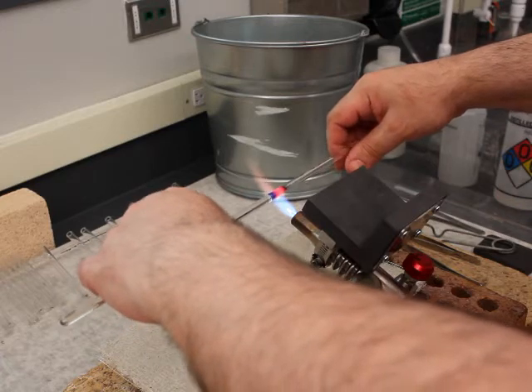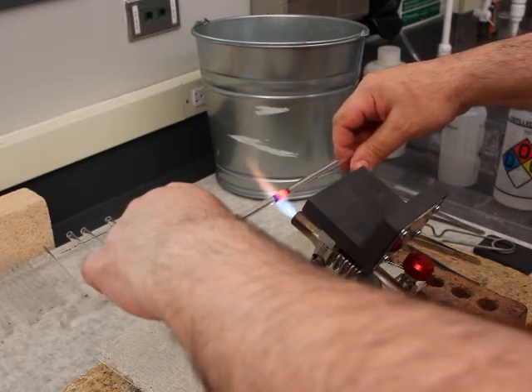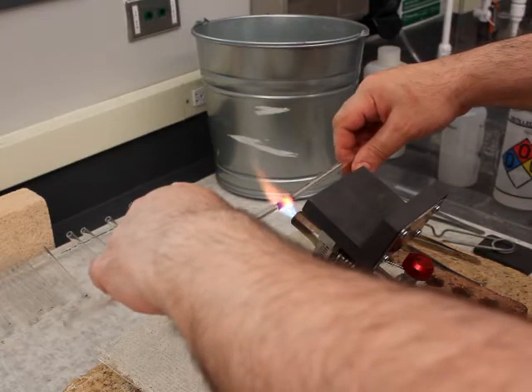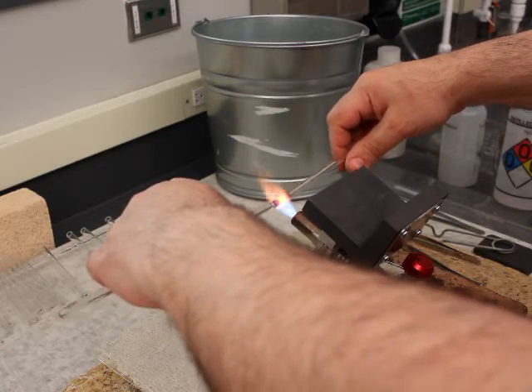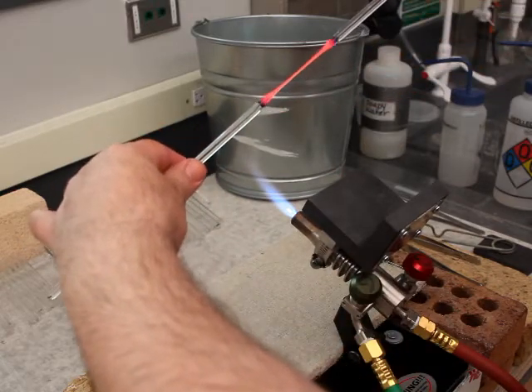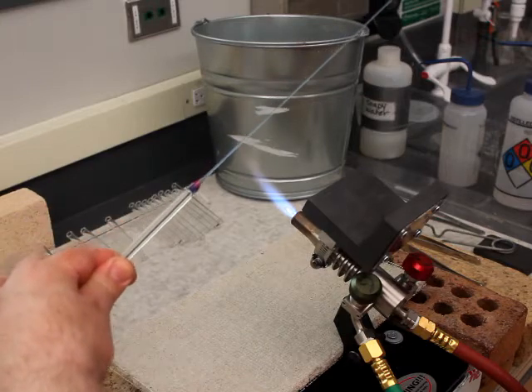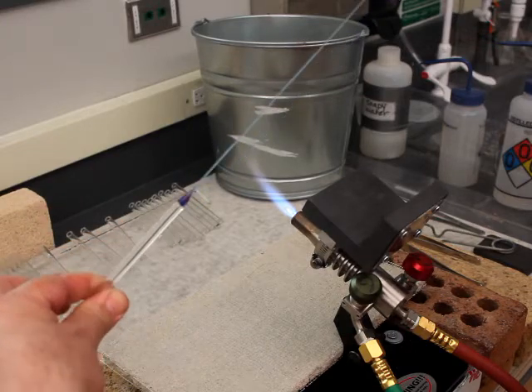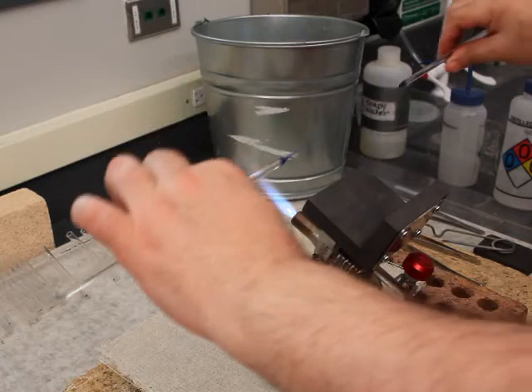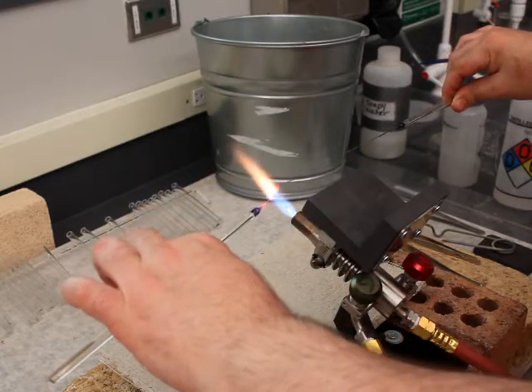Now, when I come out of the flame, I'll keep rotating, and I won't pull instantly. I'm going to let the heat uniformly sink into the glass. I didn't wait too long because I had already heated it up pretty well. But even though it doesn't look like there was much of a delay, if I would have pulled a little bit faster and a little bit harder, I could have made that fiber much thinner.